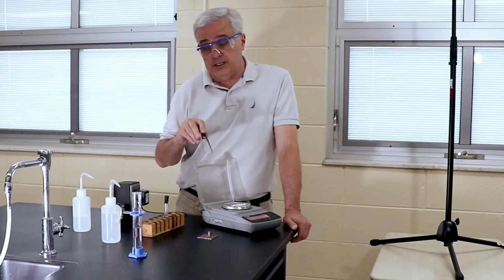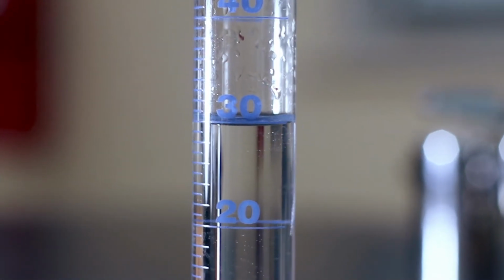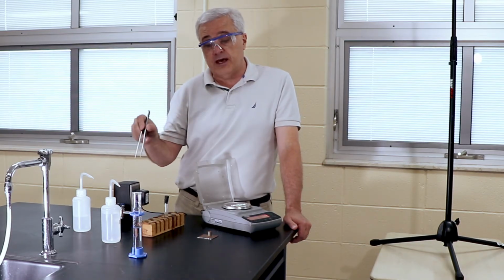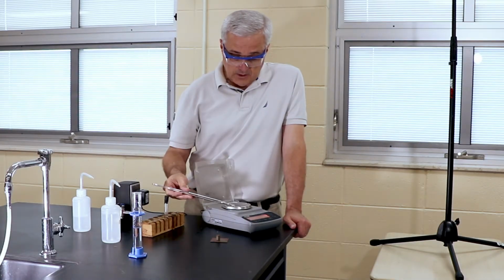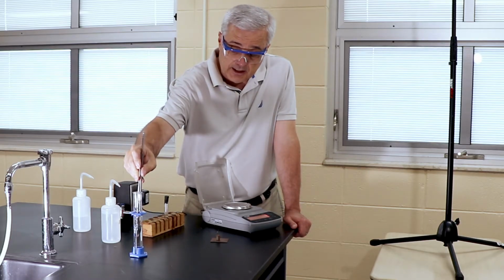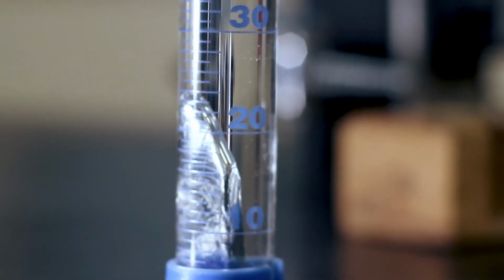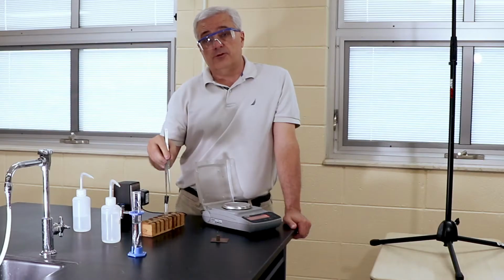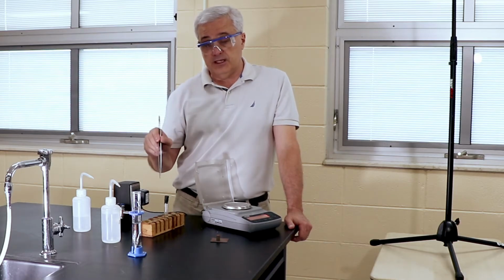We record the initial volume of the liquid, and then we're going to put the sample in and record the final volume. Then the volume of the sample will be the difference between the final volume in the graduated cylinder and the initial volume. And it looks like this. We're going to take the sample and carefully put it into the graduated cylinder. We're not going to drop it from up high because it's glass and we don't want to break it. Now that's going to raise the level of the liquid, and we're going to take that final measure and subtract the initial measure, and that's going to give us the volume of the sample.